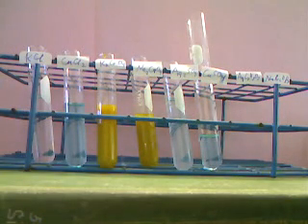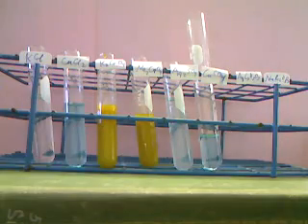And there's the result of the copper sulfate with our 5 remaining solutions. So now we've combined all the solutions in that row on our table. Now I have to go down to the next row and combine the solutions in the next row on our table.